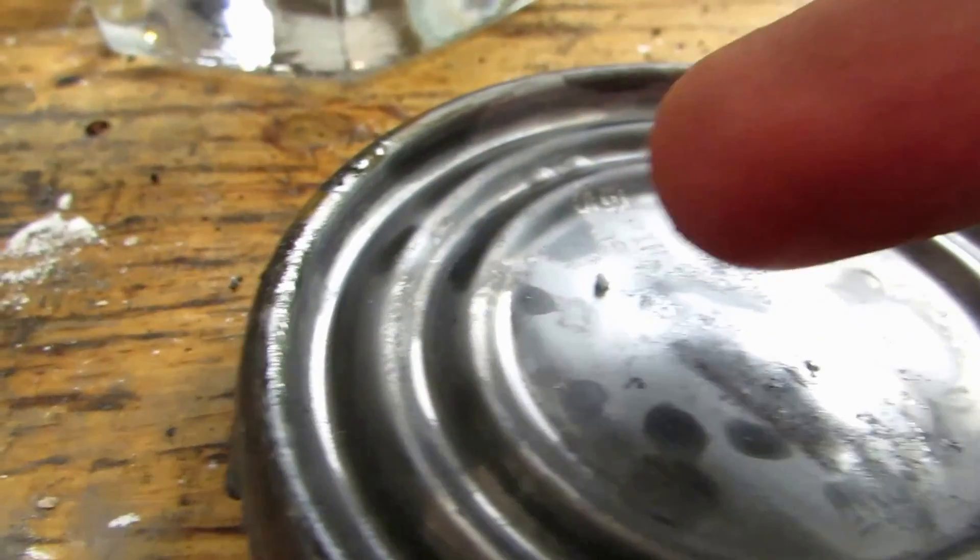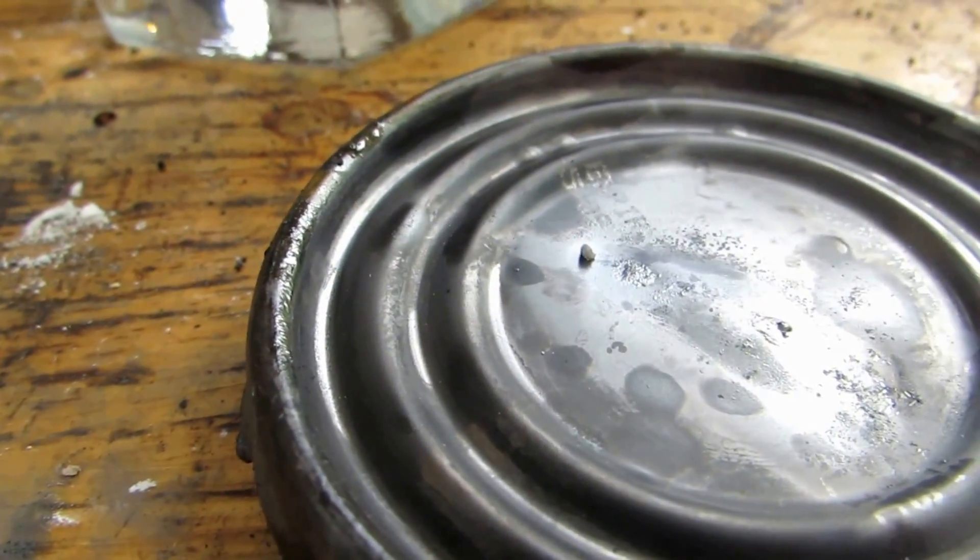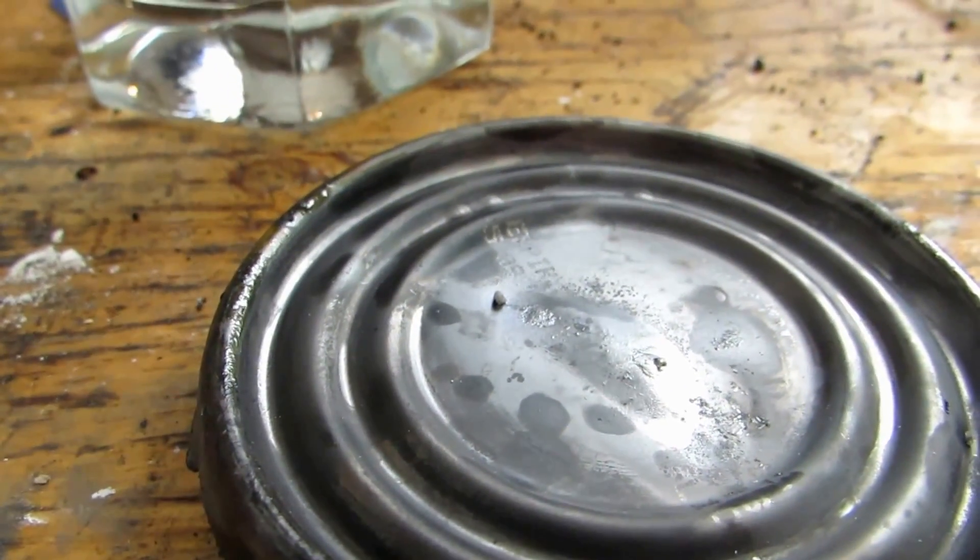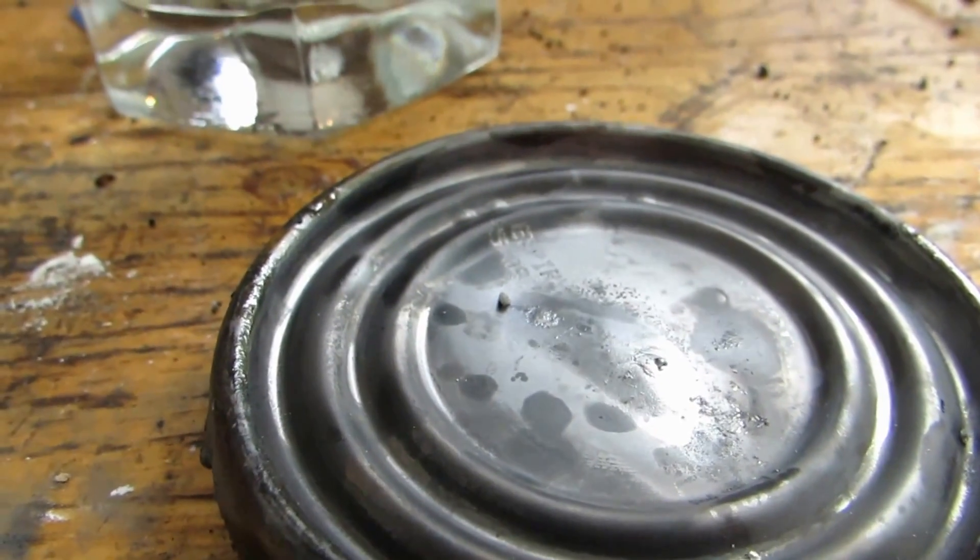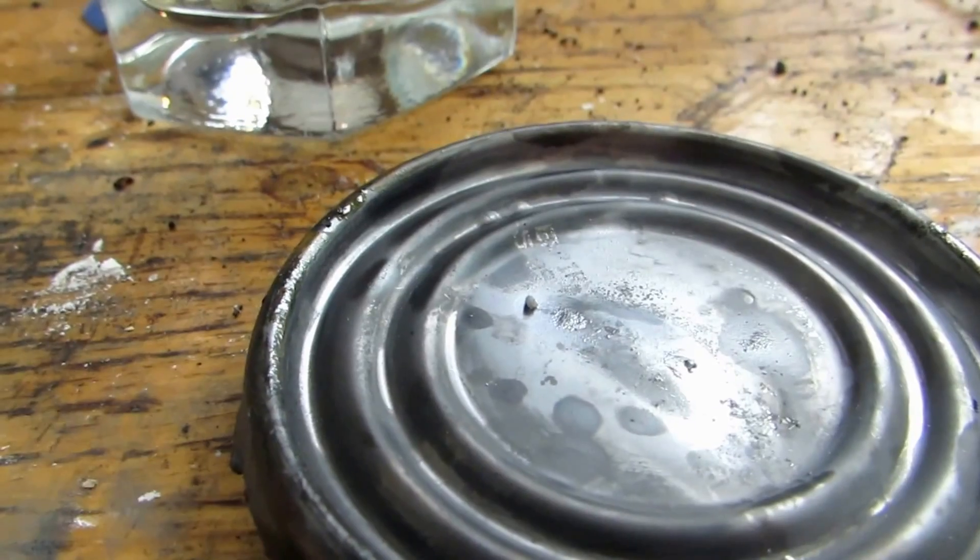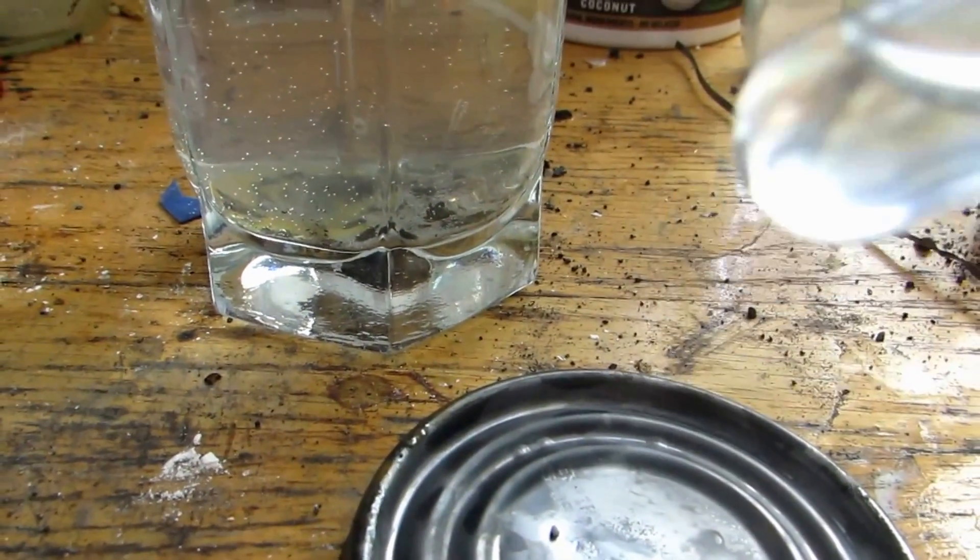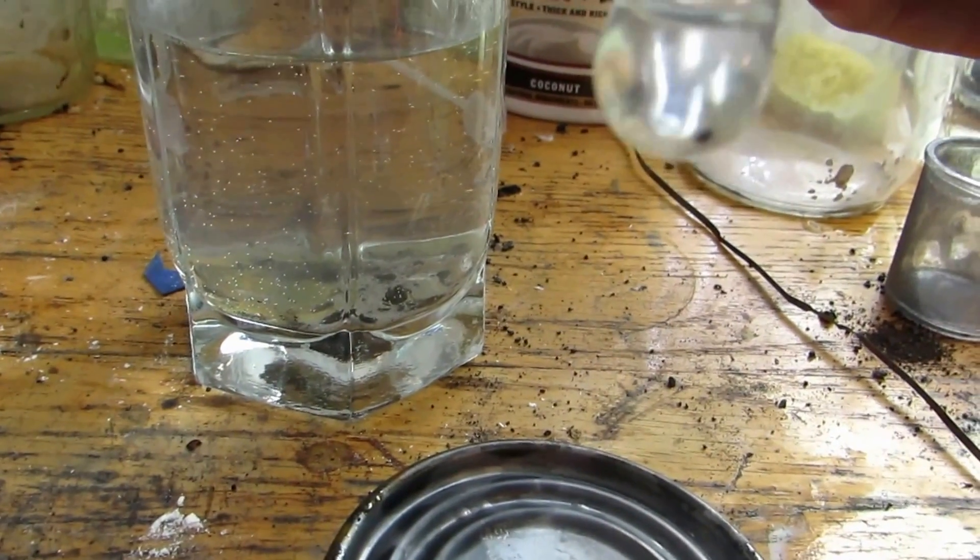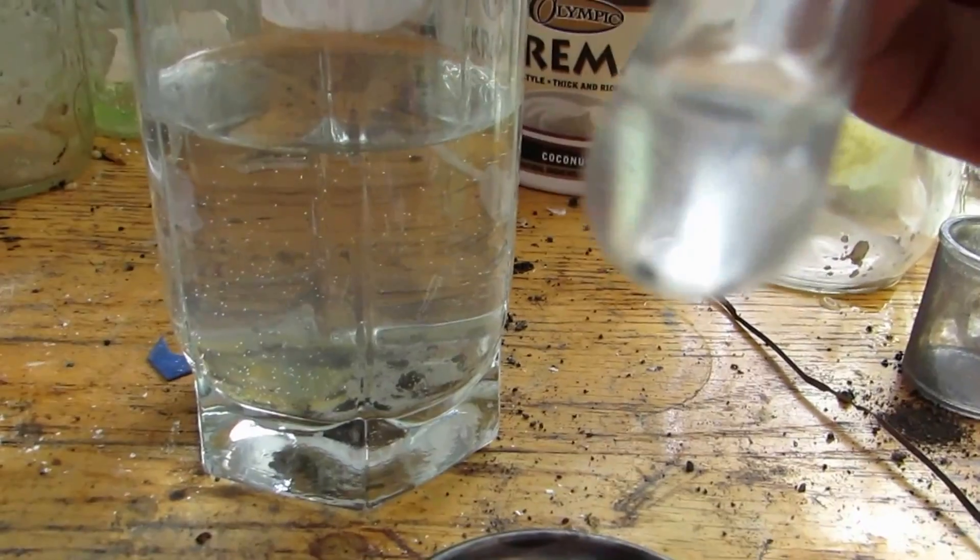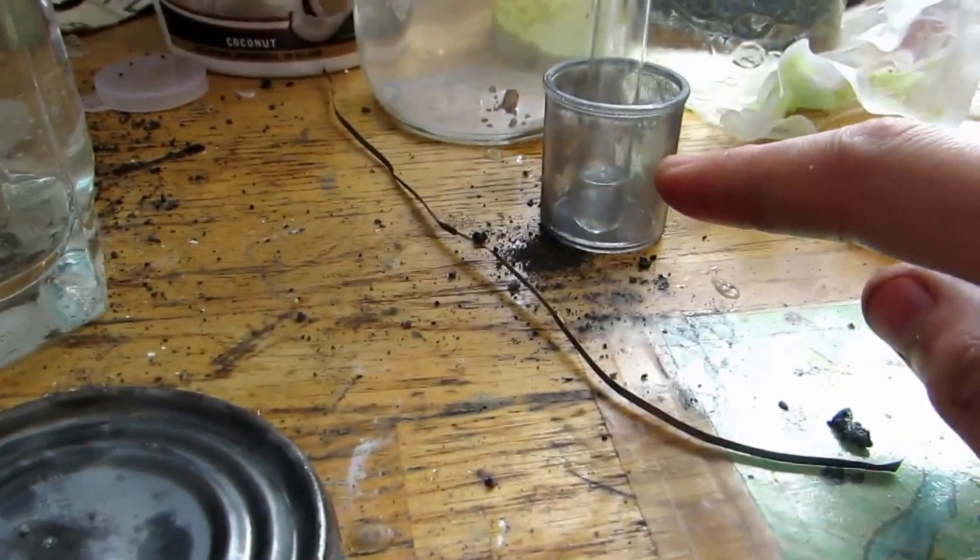Okay, the teeny little rock is actually strontium metal. It's a very teeny amount because when I was electrolyzing that solution, any strontium that touched the air was actually liquid and burst into flames. So only the stuff that was in the solution that managed to solidify in the solution was able to be recovered in these really teeny chunks. Now I have another piece in here. You can see it right there, that little speck. And that's a nicer sample of strontium. And it is a bit larger, just the curvature of the test tube makes it look odd. So that's what I'm going to be using in my element sample.